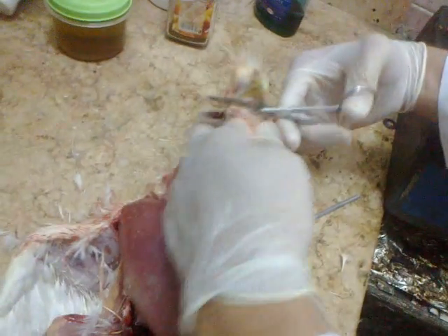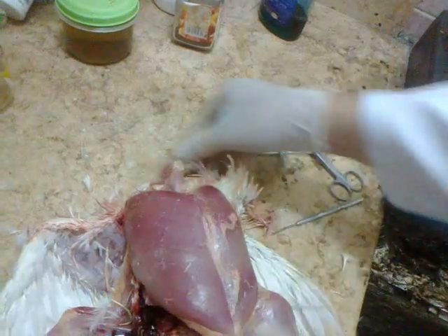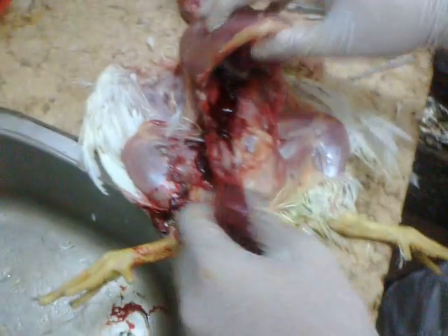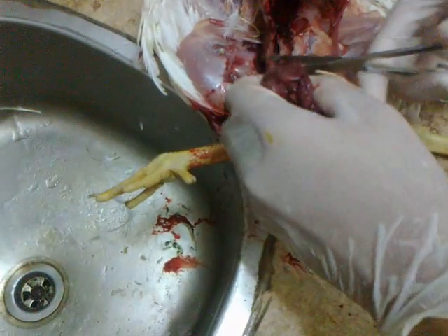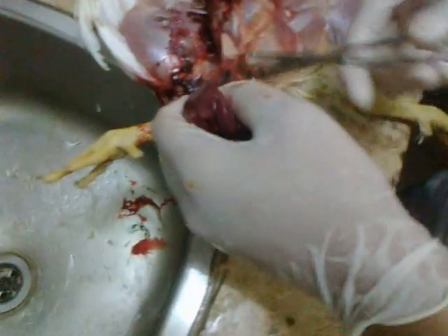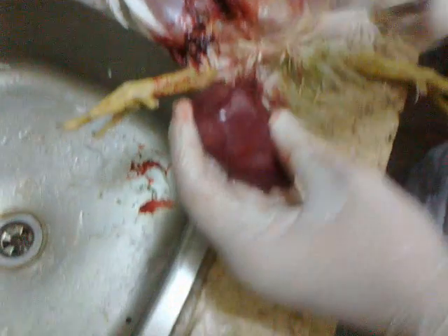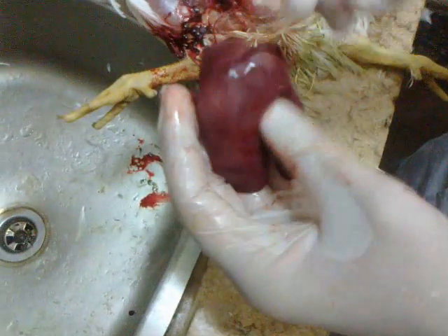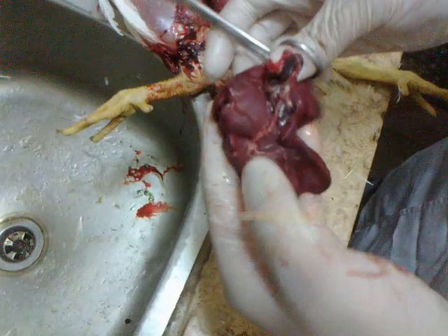Now we are examining the liver. In the liver we look at its size, its surface, fibrosis, sclerosis, and whether the bile duct is extended or not.